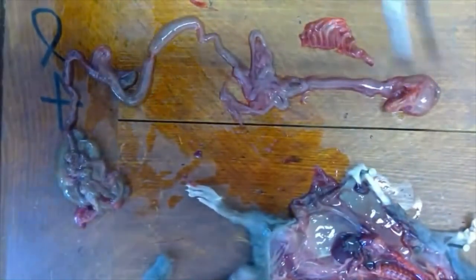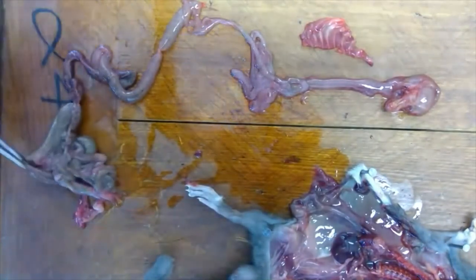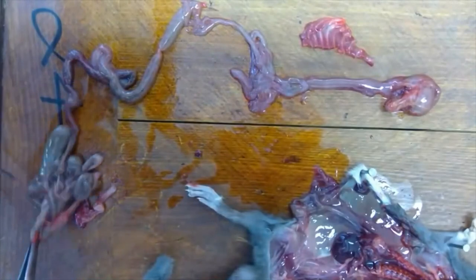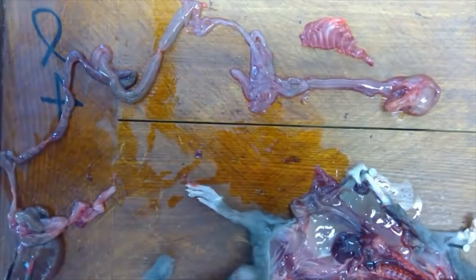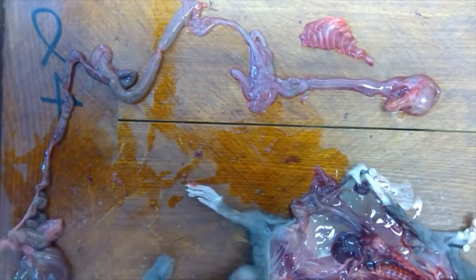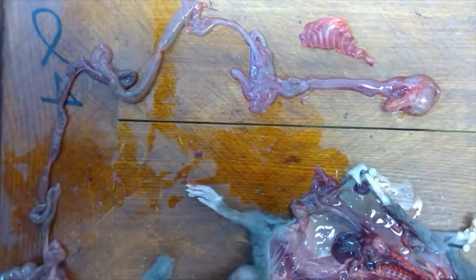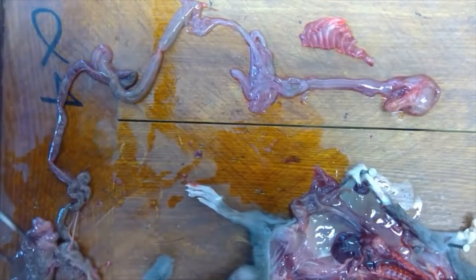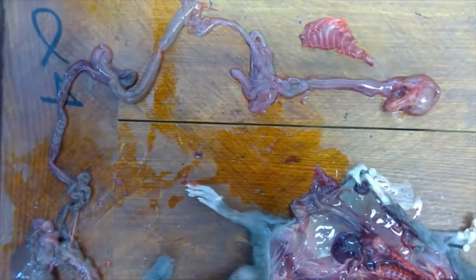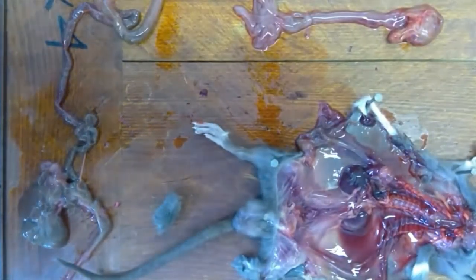You can really start to see it now: stomach, small intestine — still small intestine all the way — until we hit the caecum down here. Then the large intestine. And let me also show you what that looks like on the human mannequin.